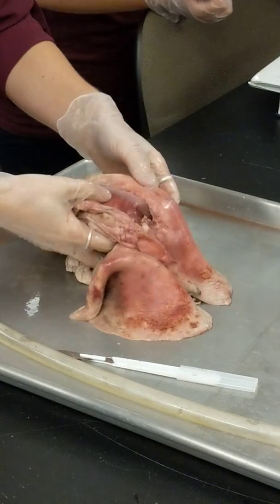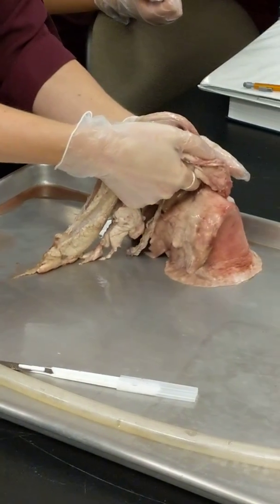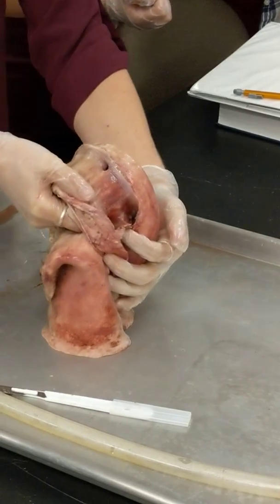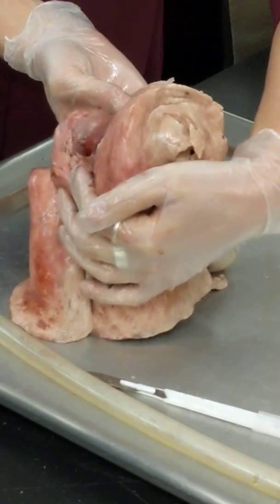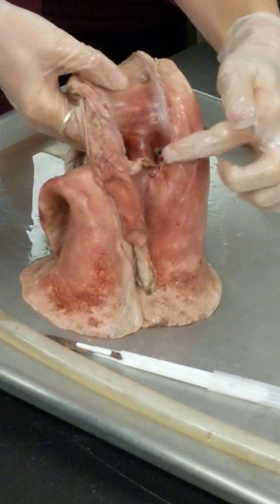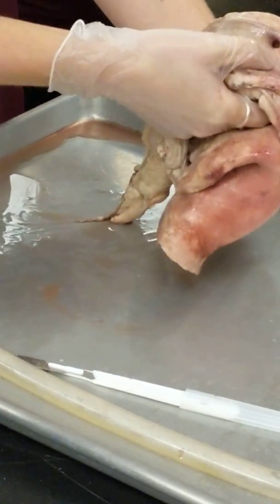So you can actually see that design at the division point between your right and left bronchus. Do you guys see that little ridge right there? I don't think it's on your terms list. It's called the carina. It's Latin for keel, like the keel in a sailboat. So that's the knife edge. That helps separate the air into the right side and the left side, so there's no turbulence built up right there. That's for maximum effectiveness.